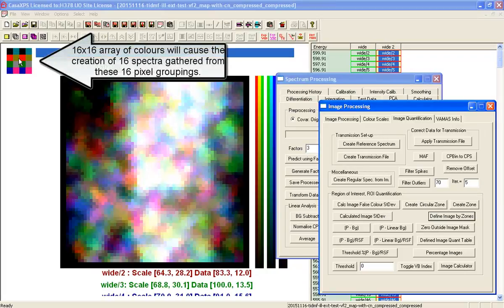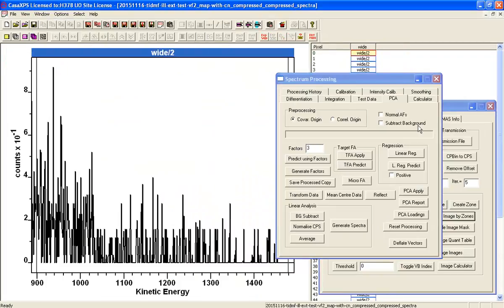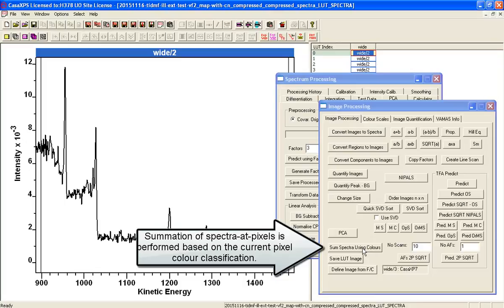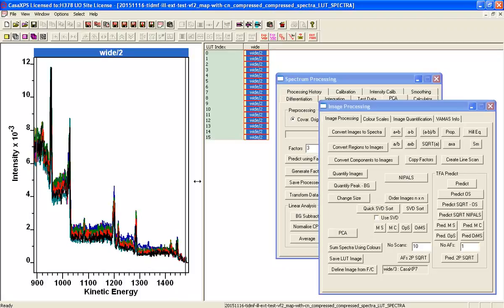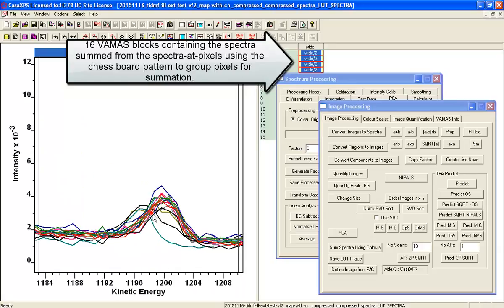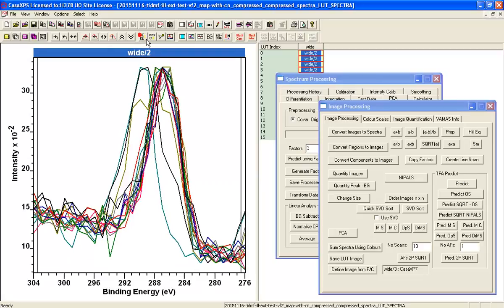We've got a checkerboard, and if I go back to my spectra and sum spectra using colors, I will get 16 spectra, and these give us an indication of what's happening in different positions in this image. And you can see straight away by zooming in to this carbon peak. Let me just put it in binding energy again.